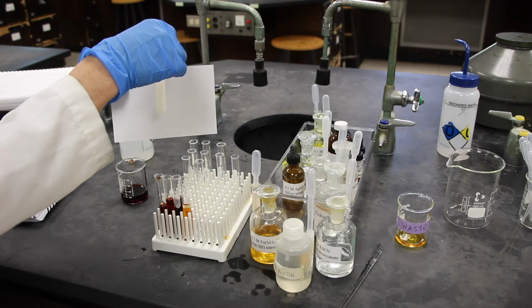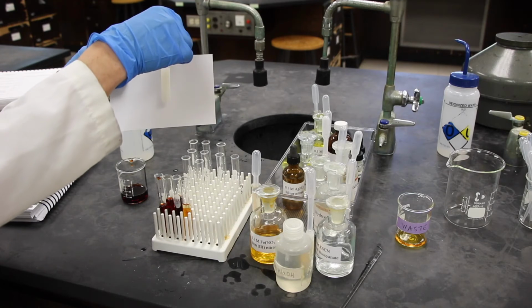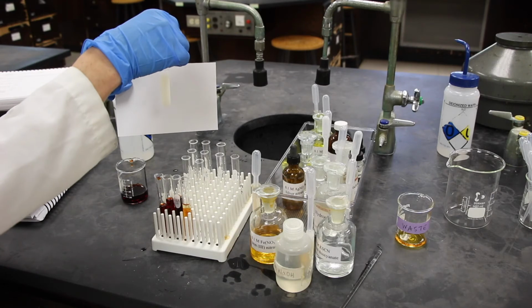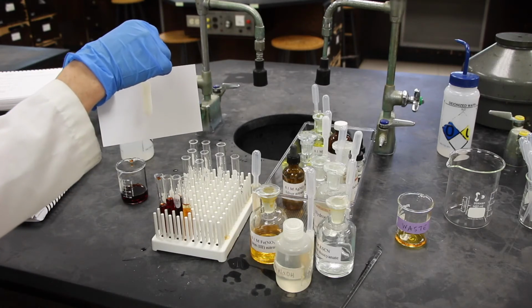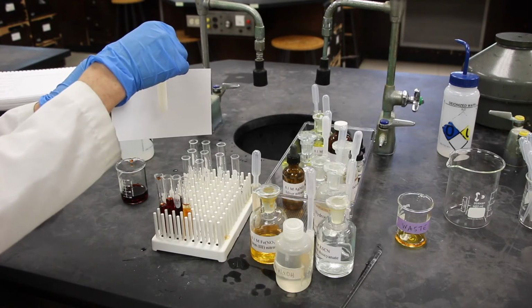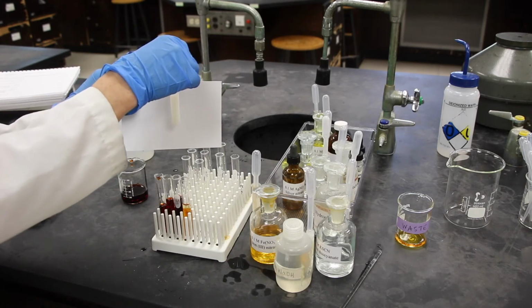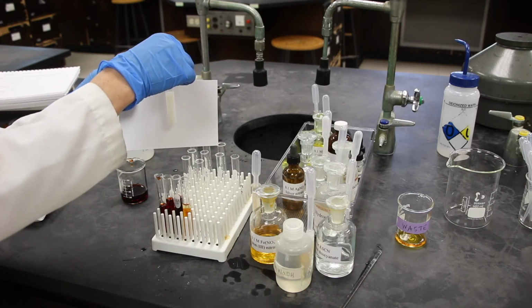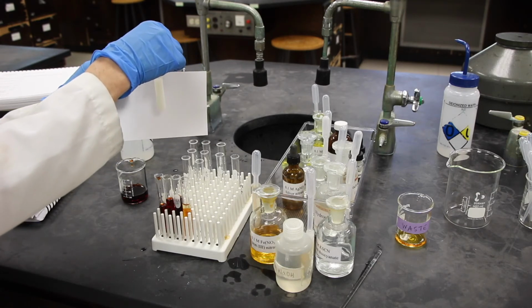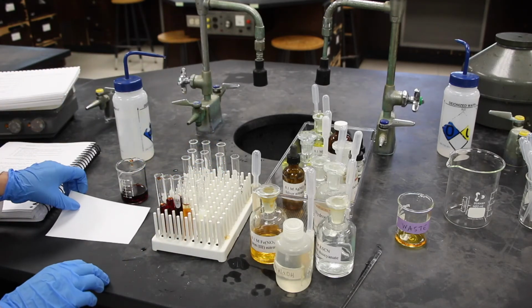It's very cloudy, so you can know that there is a precipitate that is suspended in solution here. If we centrifuged it, you will get a precipitate at the bottom. And there's help in this step that the Ag plus ion will react to form an insoluble precipitate. So again, that is a one-way arrow. It's not an equilibrium arrow, and I'd like you to write that reaction too. From this, you can complete the rest of the data sheet.